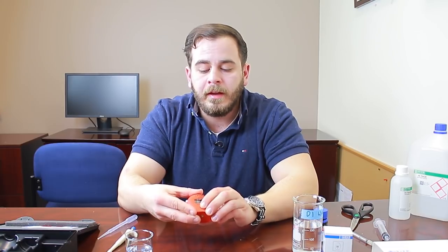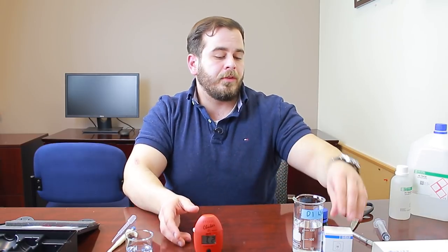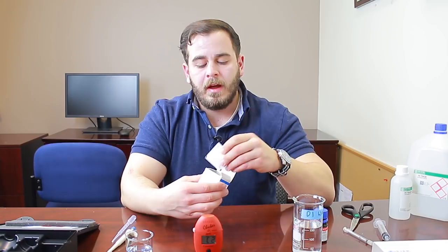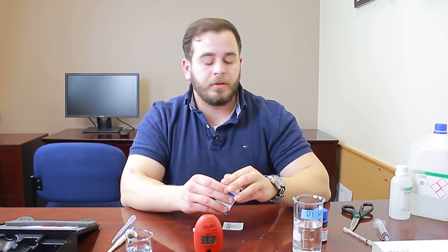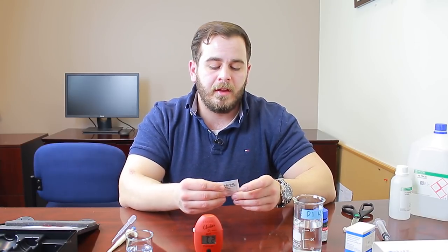Insert the cuvette and hit the button again — the checker will flash a few times and go to the C2 phase. At this point, take one powder sachet of reagent B. The test comes with 25 sachets, enough for 25 tests. Checkers tend to be more economical in the long run because you're only buying reagents, not a whole new checker. Extra reagents are available from major retailers, local fish stores, or online retailers.